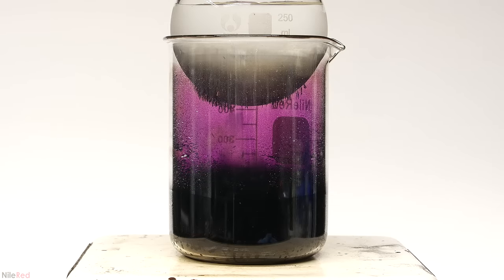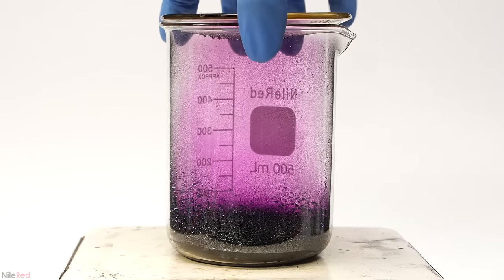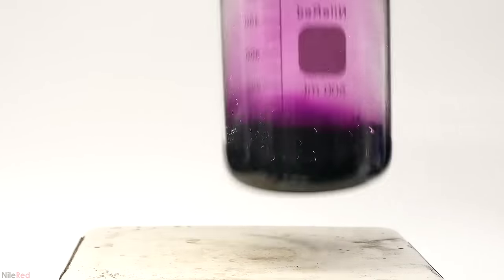Okay, so for me, this is pretty good evidence that it melts, and that a liquid phase does in fact exist, but to really just drive it home, I'm going to do one last thing. I add a whole bunch more iodine to a beaker, crank on the heat, and quickly melt it.